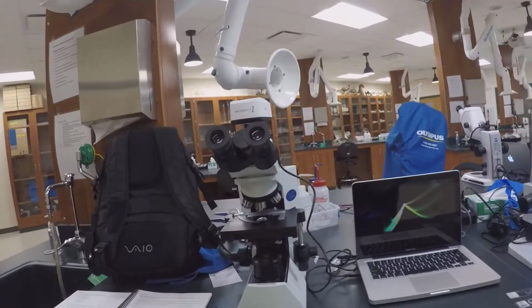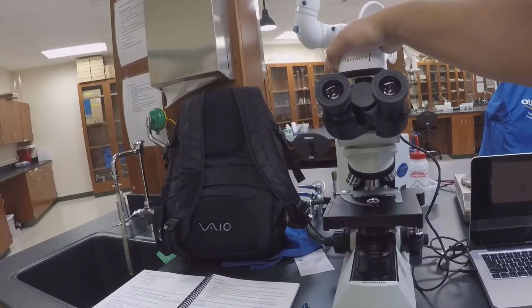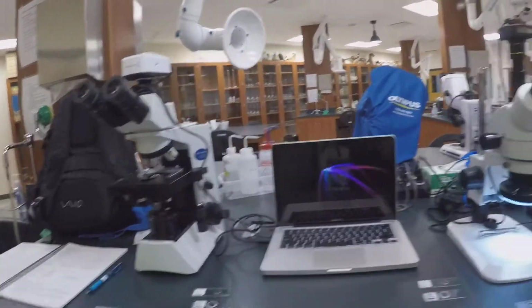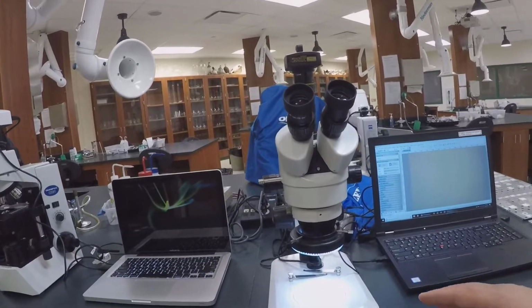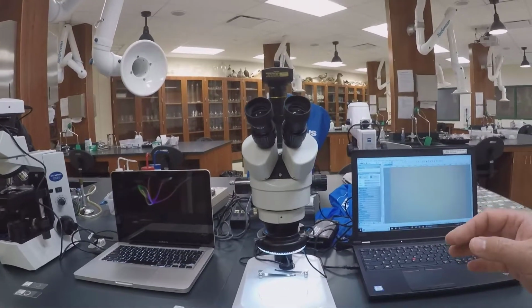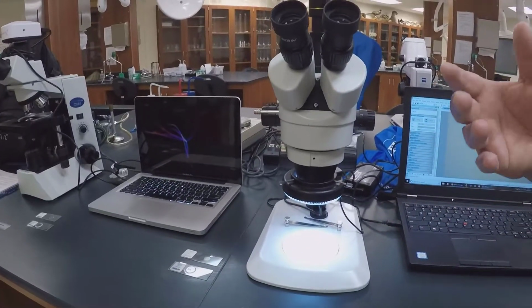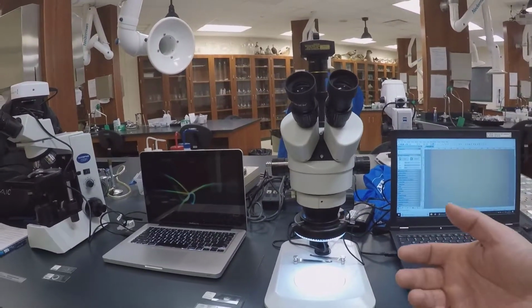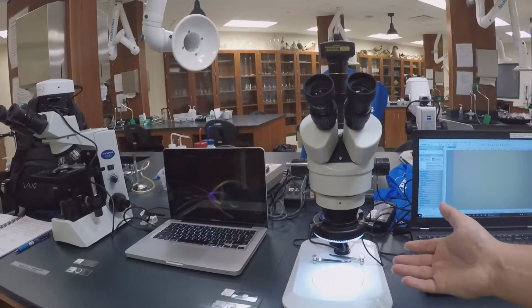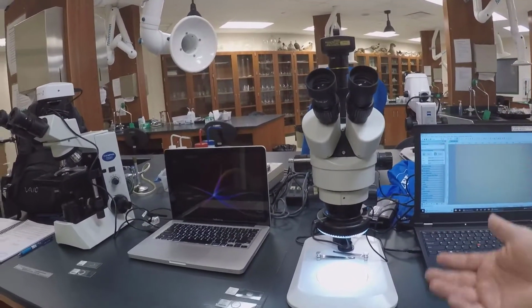They have very different uses. The compound light microscope is normally used to examine things that are going to be on slides. Well, always going to be on slides. The dissecting microscope, you can use slides on it, but often it's used for things that are not going to be mounted to a slide, but rather can be placed in something like a petri dish or in a dissecting tray, and you can manipulate the organism while it's under the scope.